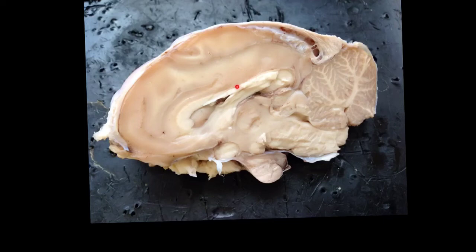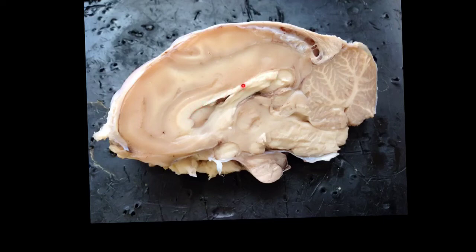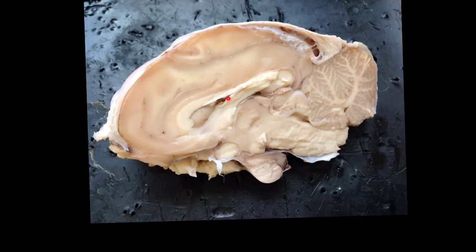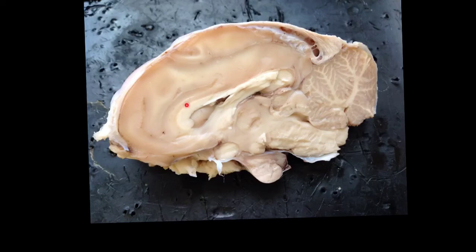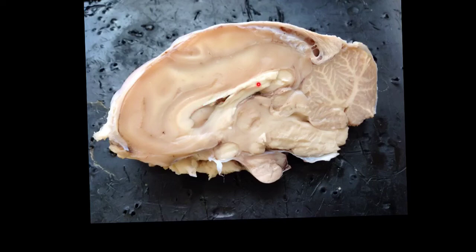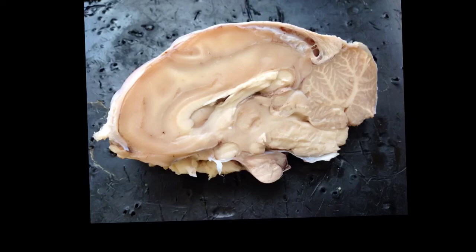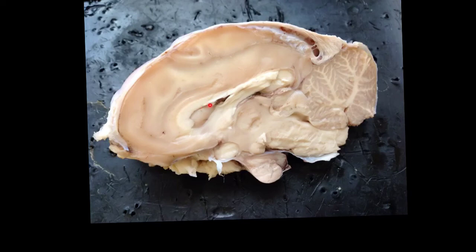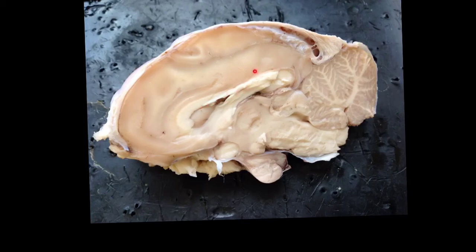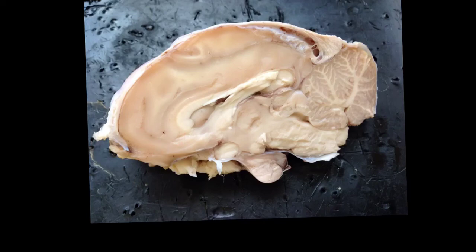Another large structure of white matter, which I'm highlighting right here, is called the corpus callosum. This actually connects the left and right hemispheres of the cerebral cortex. That's another very good general landmark whenever you're looking at a dissected brain — you're always going to see it right there, and you can always pick out that significantly lighter tissue compared to the rest of the cerebral cortex.